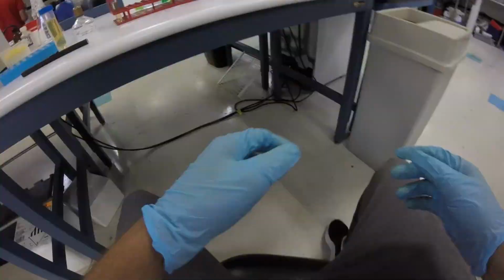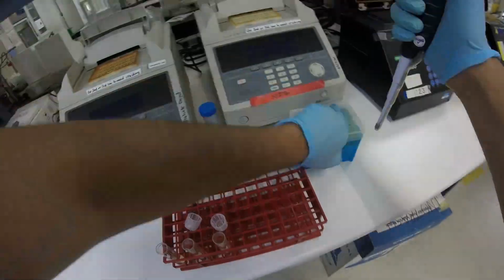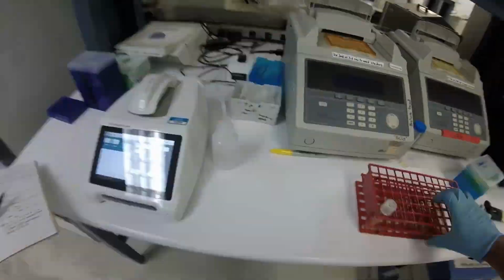Anyways, the point is we need to go in two stages, because we have this blue plasmid, I think. But the trick is that we need to get it first into E. coli so that we have it propagated. And this requires a new technique, I think it's called Gibson assembly, which is basically a technique to insert a gene into a plasmid. I hadn't even thought of that before, because I've just been given the plasmid. But what happens if you need to make a plasmid? It's a super powerful technique, and I need to learn a lot more about it and how we're going to do this.